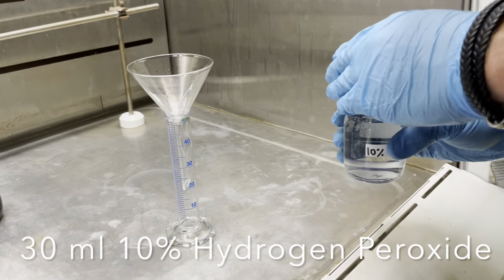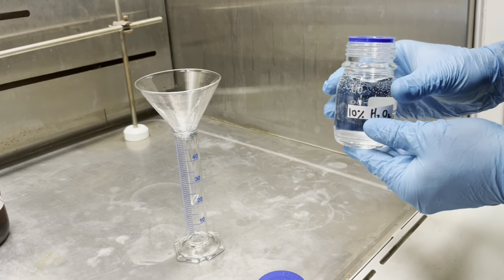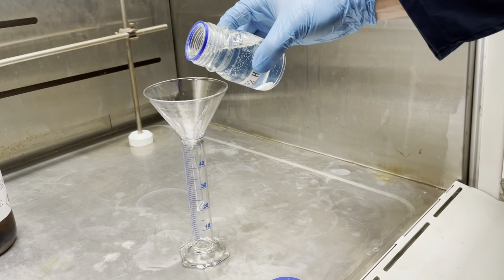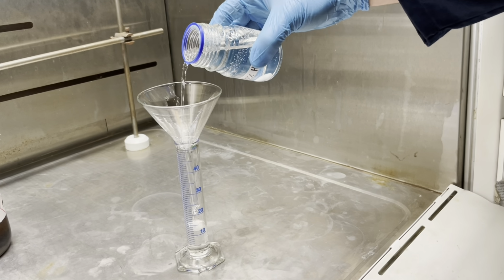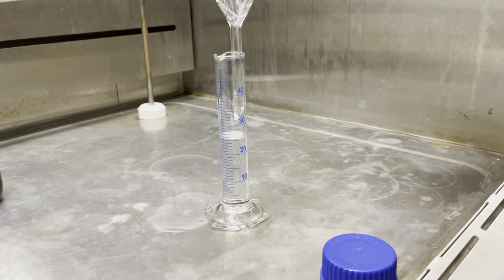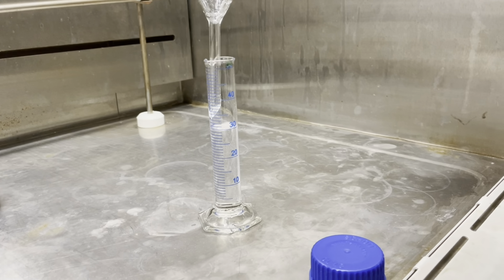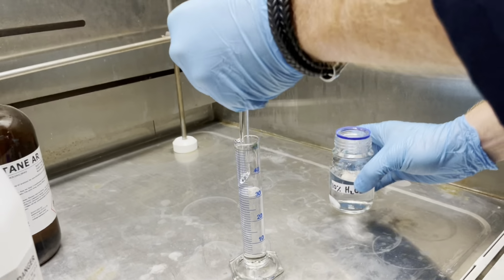Next, you will collect 30 ml of 10% hydrogen peroxide, again using a measuring cylinder and a funnel in the reagent fume hood. As always, this is an approximate measurement, so if you take 31 ml, that's also perfectly fine.